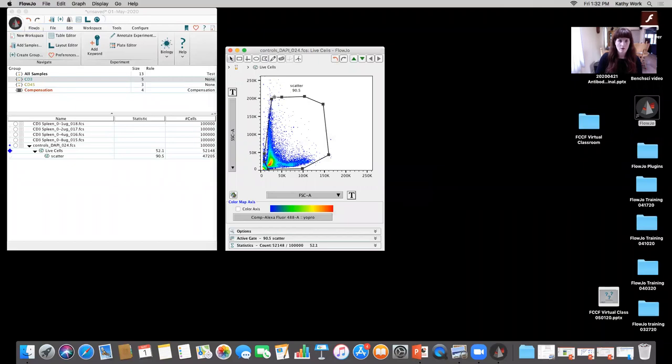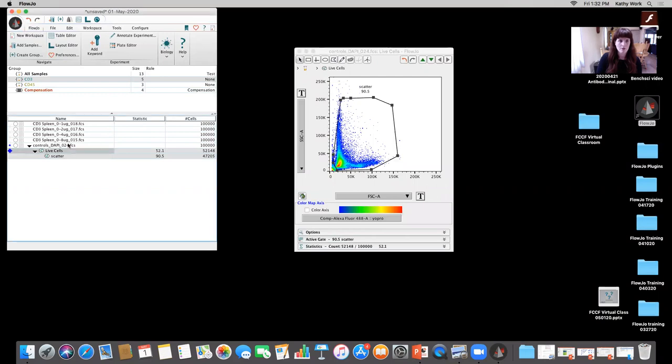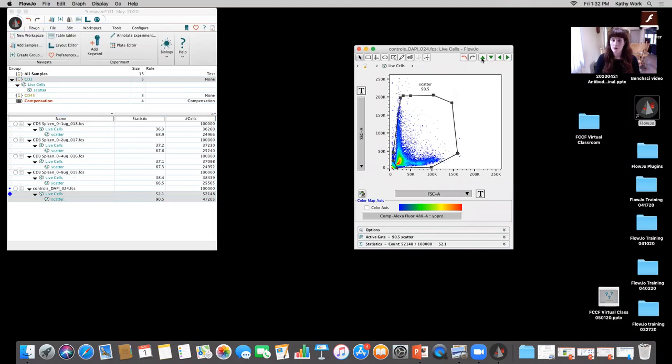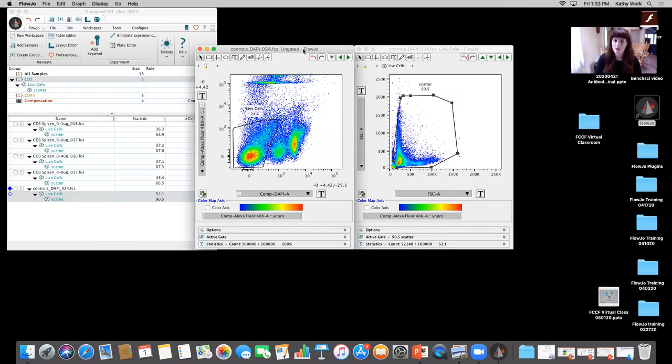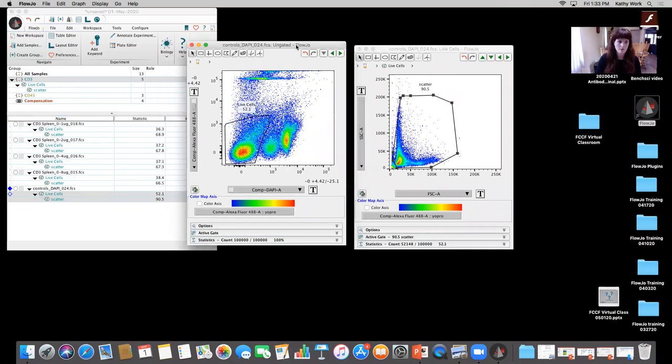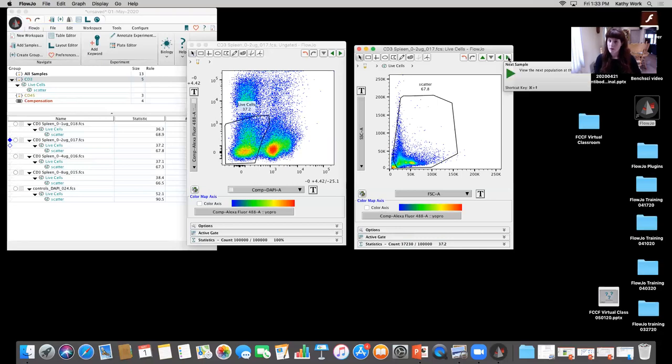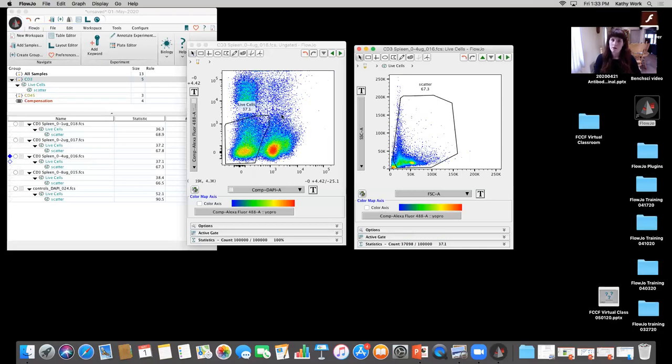So then I can go ahead and take these two gates that I've created and drag that up to everything from the CD3 group. If I lost that previous plot that I had gated my live cells on, I could always do up to parent population and go back and get that plot visible to me. Typically what I'll do from there is I'll scroll through by hitting the shift key and then the little green arrow right here. And when I do that, it's automatically changing these to the appropriate samples. And it's allowing me to do a quick gating check as I go along, okay?